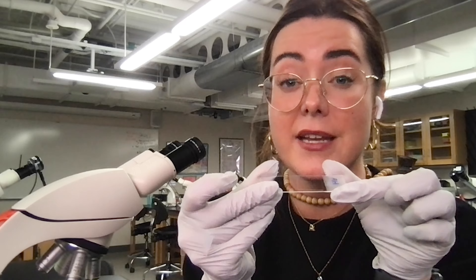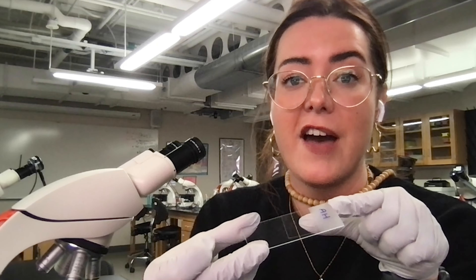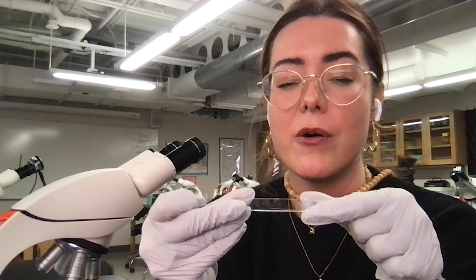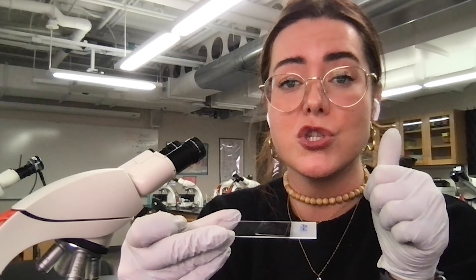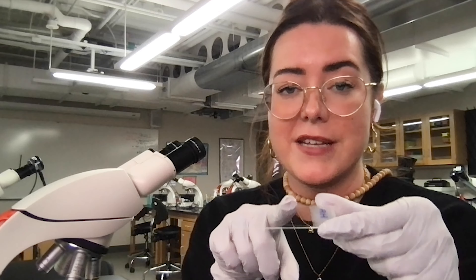As a reminder, you should start off focusing your microscope. Here I have my initials written on the side. I'm going to use my 10x, my lowest power objective, to focus in on my initials here before bumping up to the 20x, making sure we're still in focus before moving over to my specimen.